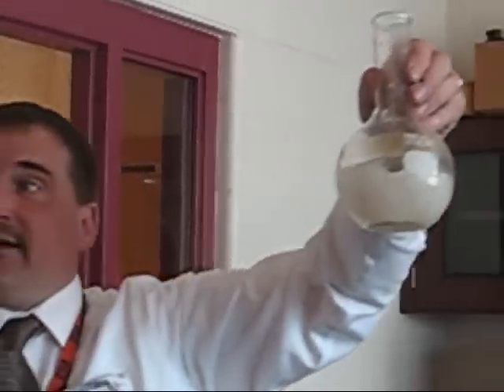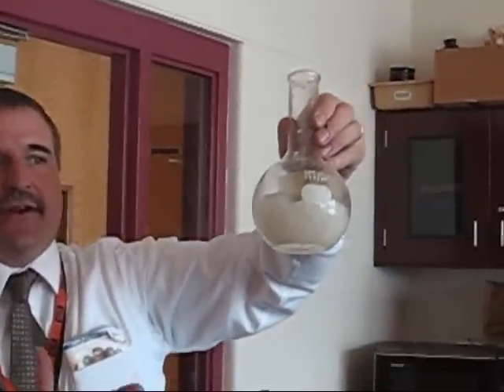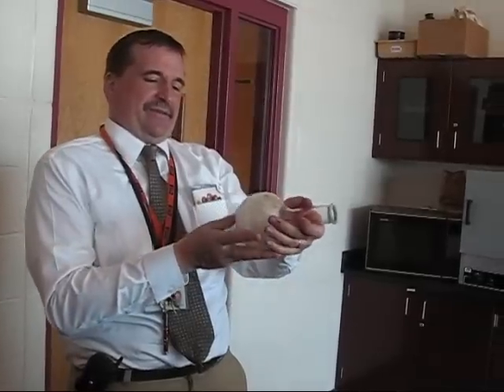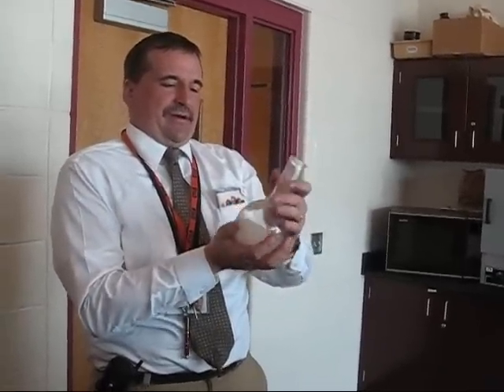What's really cool about this is you can use this phenomenon for a hand warmer, because it gets nice and warm when it crystallizes. It feels like a warm puppy. Well, this one didn't get that warm — kind of a lukewarm puppy.